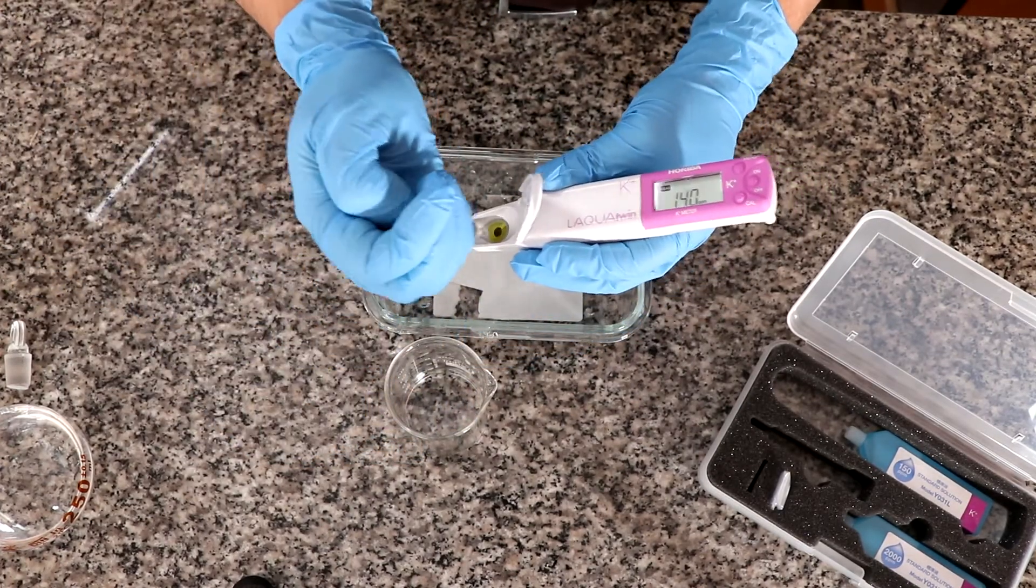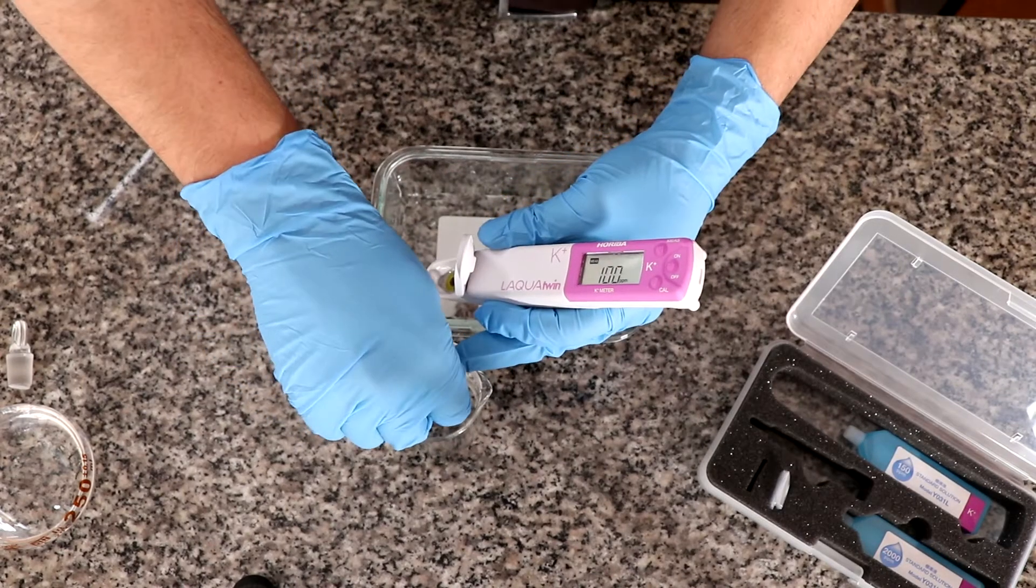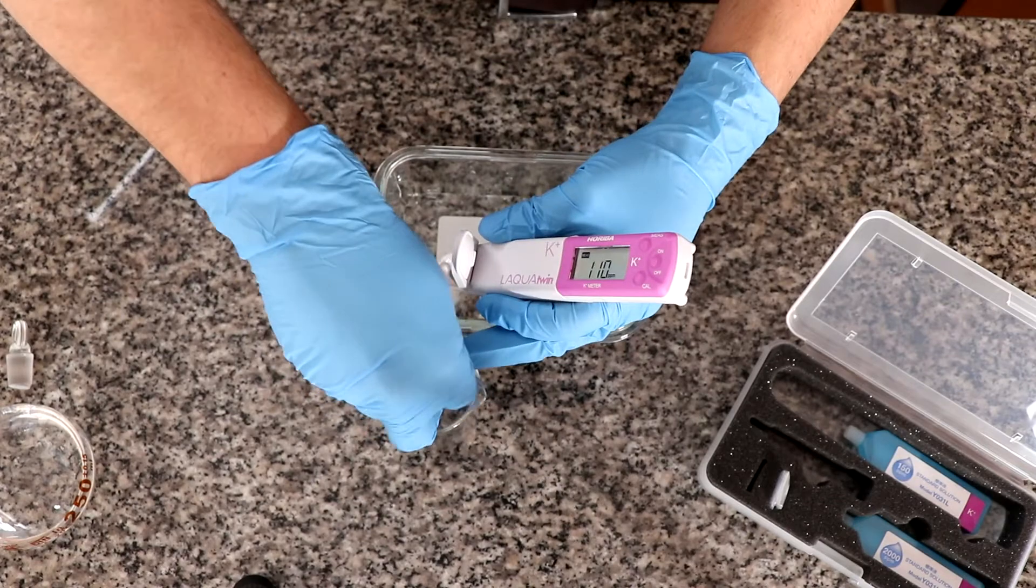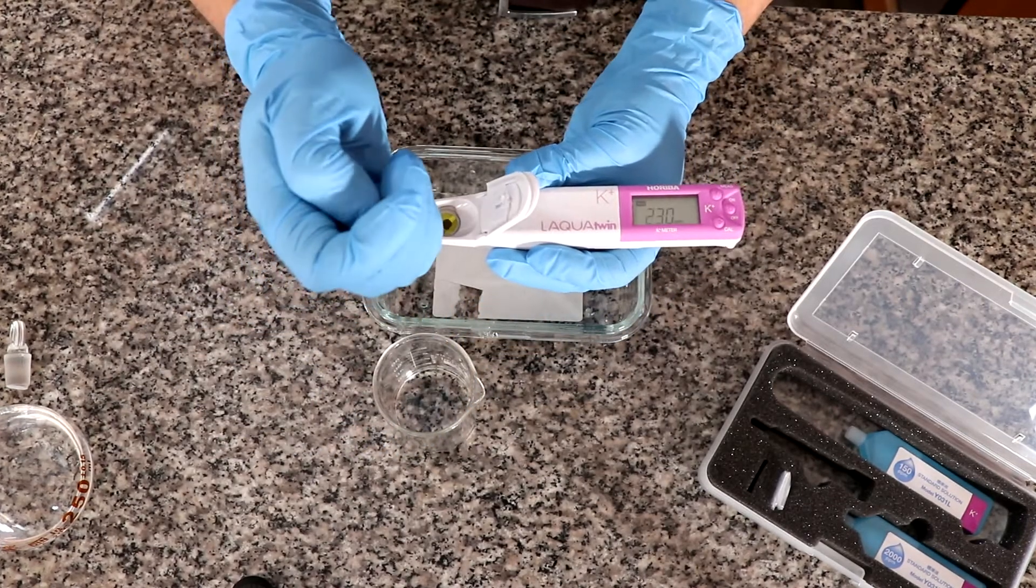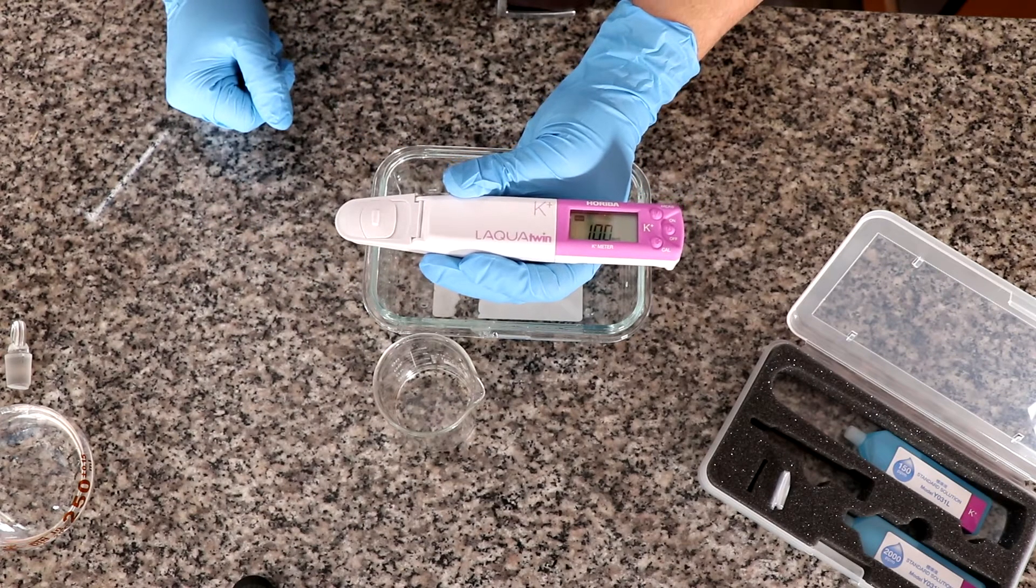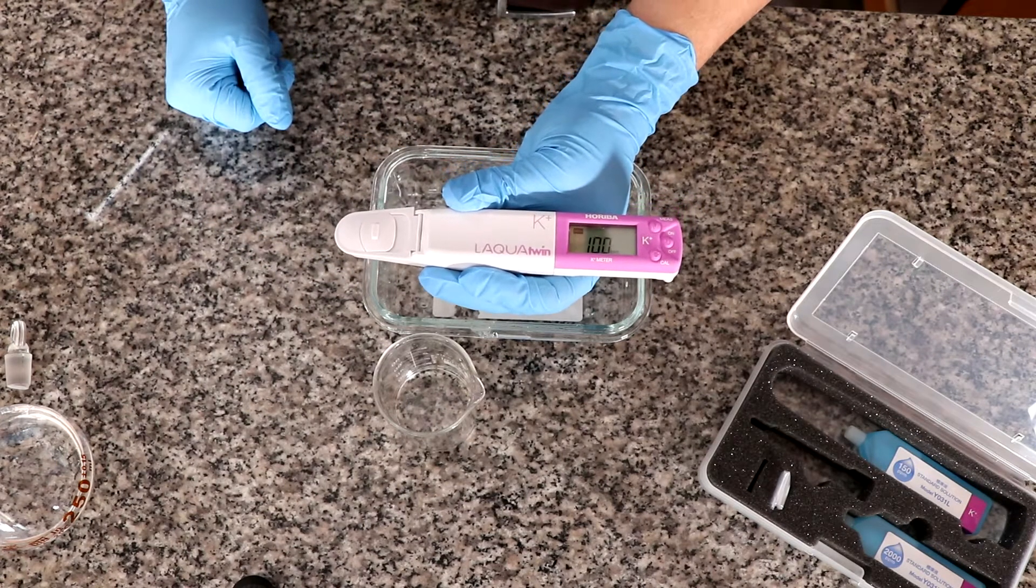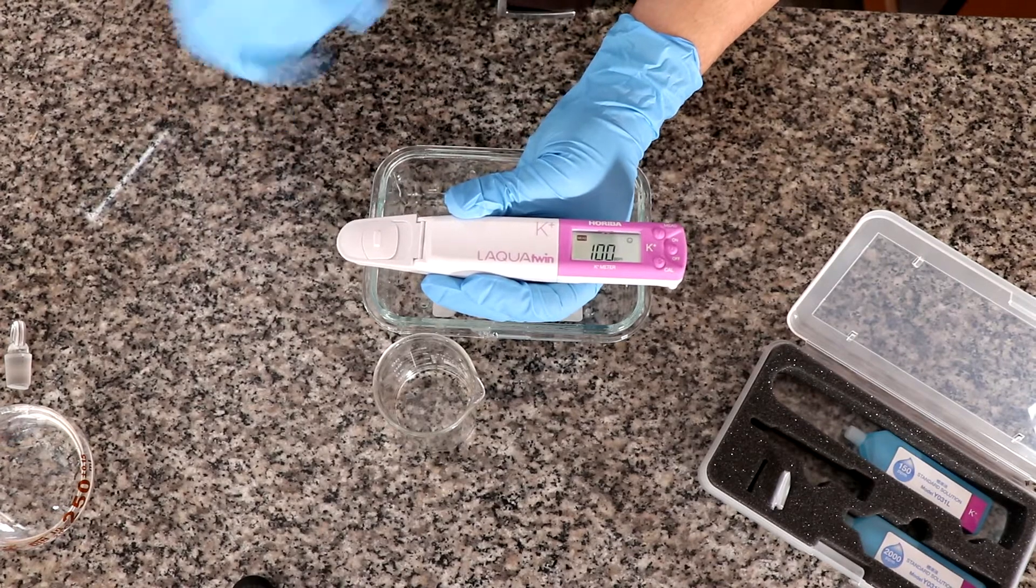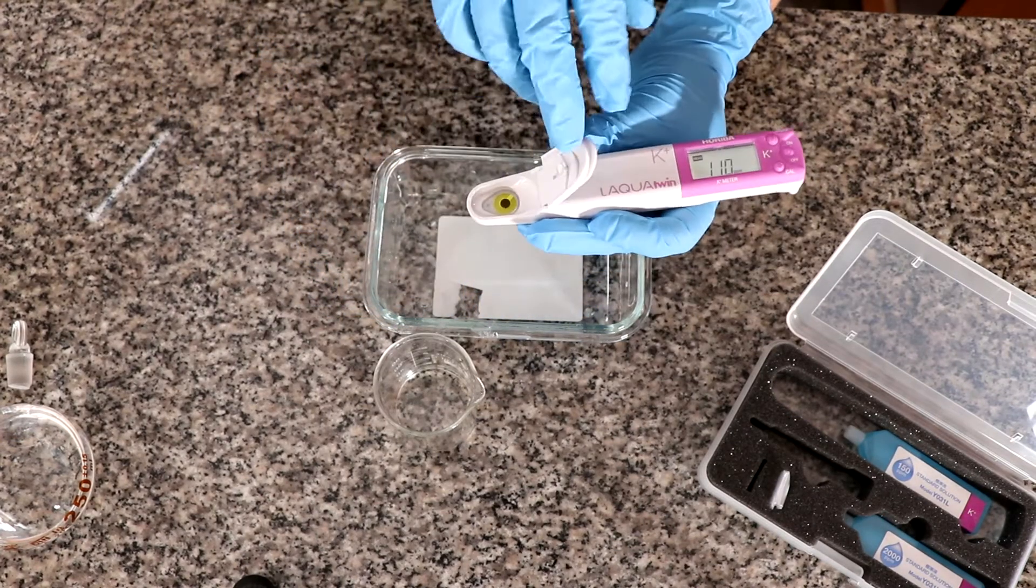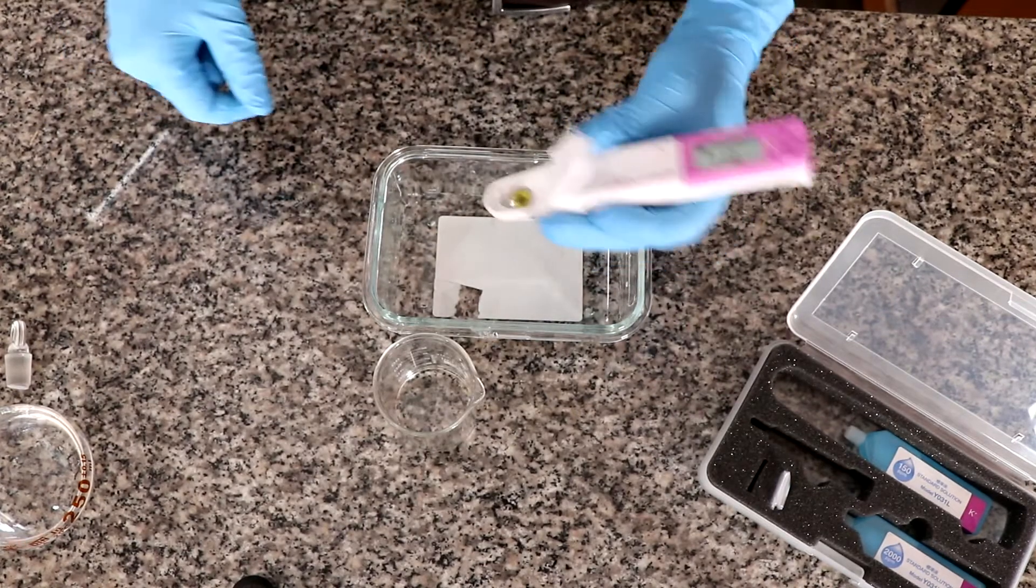So I'm going to just do it once again to see if we are really that stable. Close it again. And we have 100 ppm again and we've measured three times. So we know this is going to be pretty accurate.